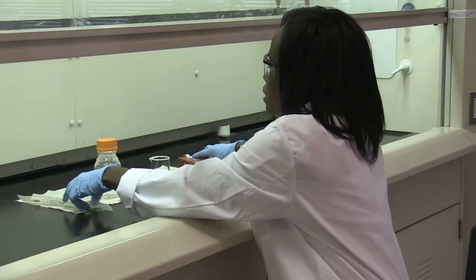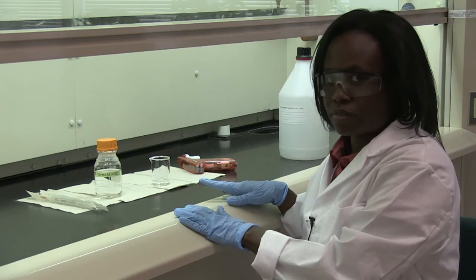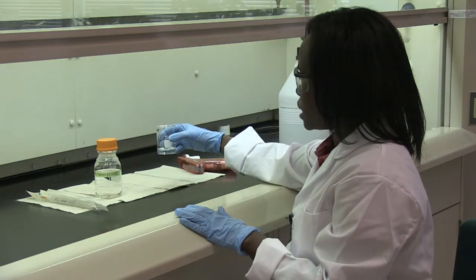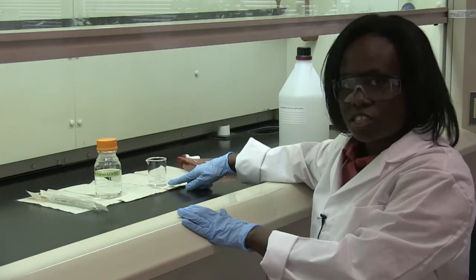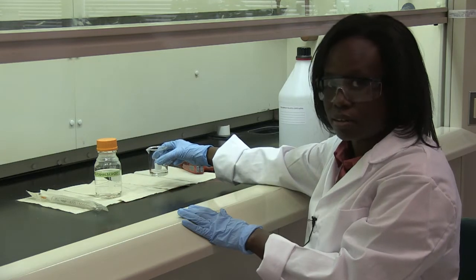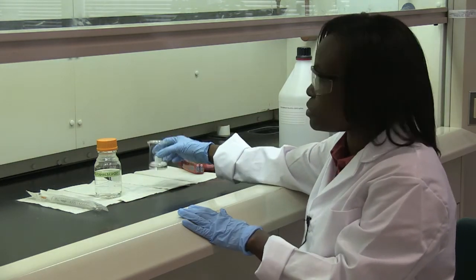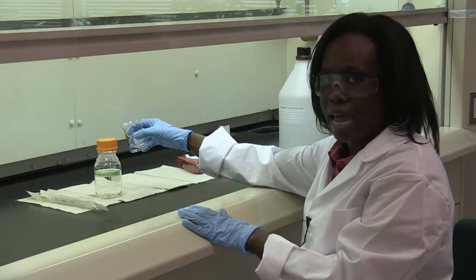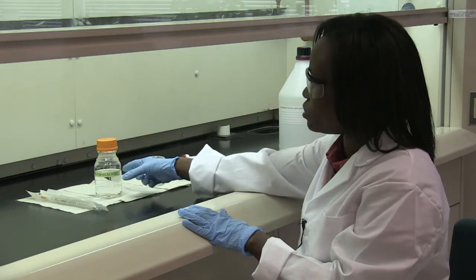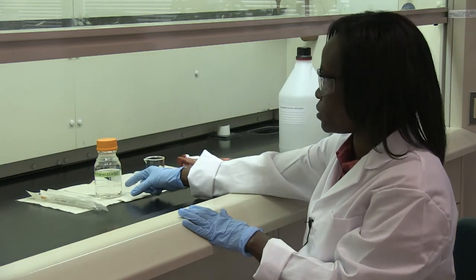You'll find this results in very little spillage. If you don't need as much formaldehyde as you originally thought, and there is some left over, never pour it back into the stock bottle. Doing so can introduce contaminants back into your stock solution. That is very important.